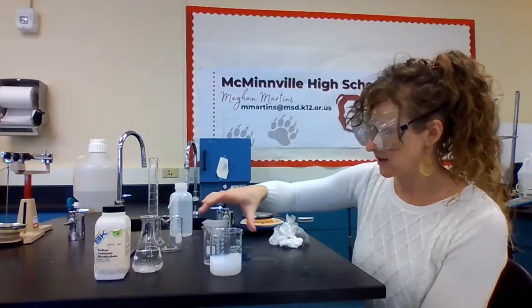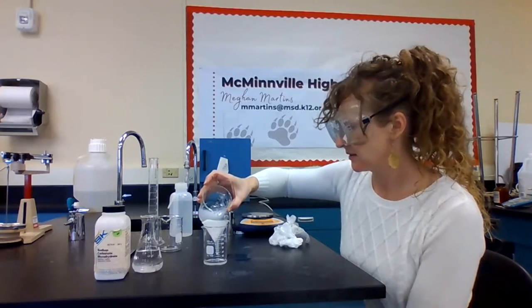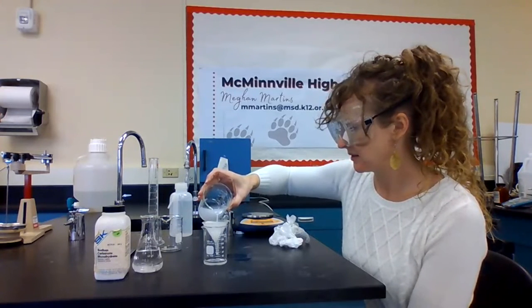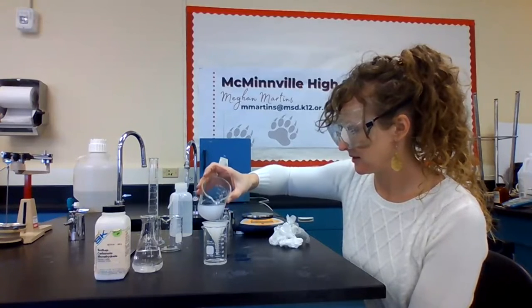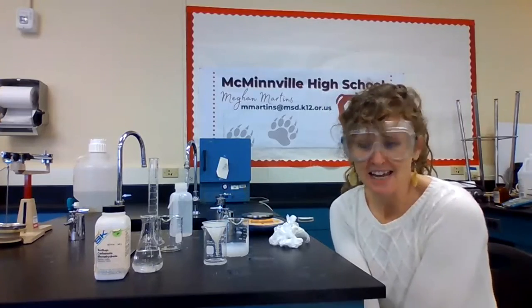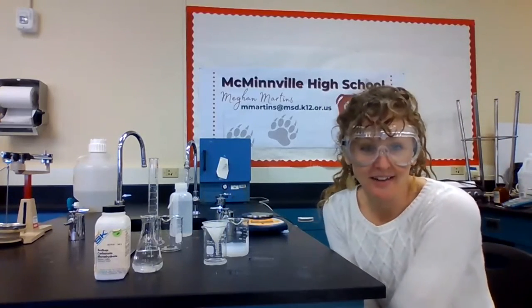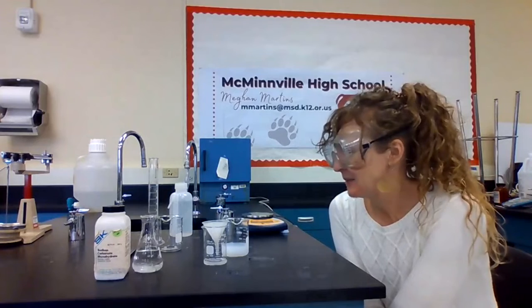And then I can start to filter it out. Since this is going to take a little while, just like our last filtration did, because we are not using a vacuum filtration apparatus, I'll pause it here and I'll show you once it has all filtered through.